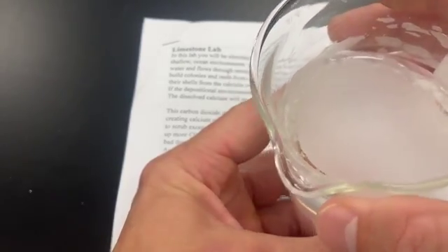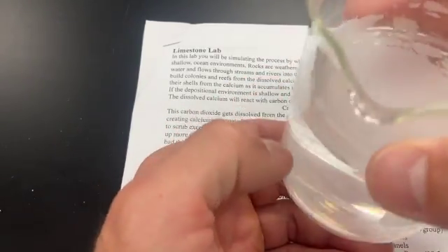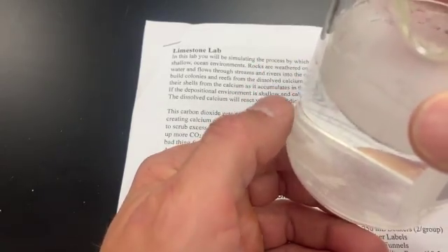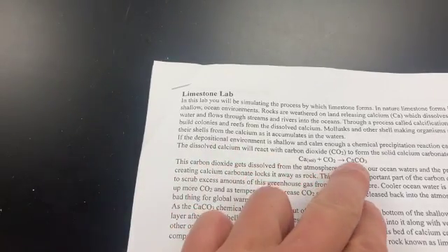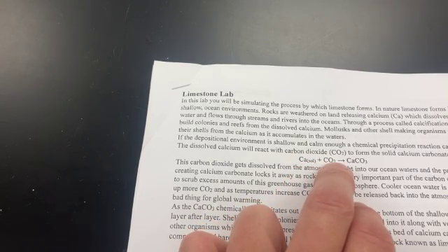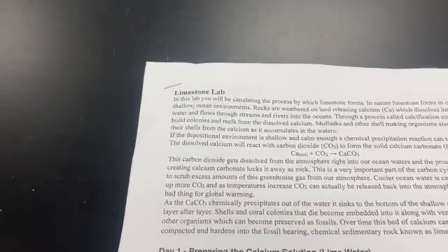That's what's going to essentially settle to the bottom of the ocean to become limestone. The reason this stuff formed on top, even though the rest of it's clear, is because there's a reaction going on between the carbon dioxide in the air and the calcium that's in the water. Think back to the formula for limestone, CaCO3. What you need to make it is calcium, which we have in solution already, and we need to add CO2 to it. A great source of CO2 is what you breathe out because you produce it. So we're going to use our own production of CO2 to create this stuff.